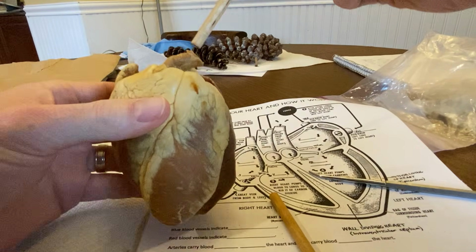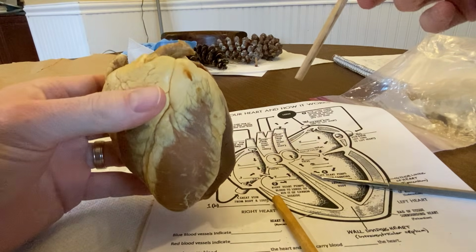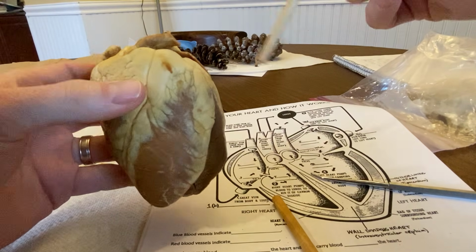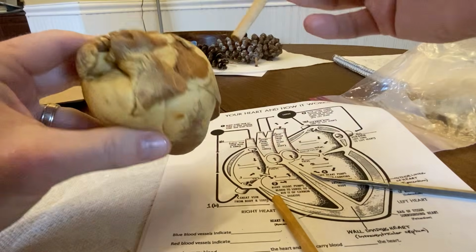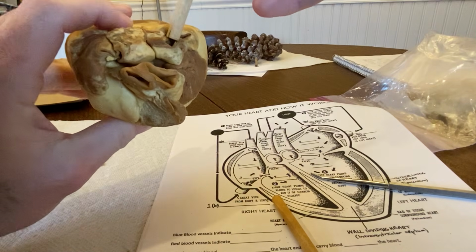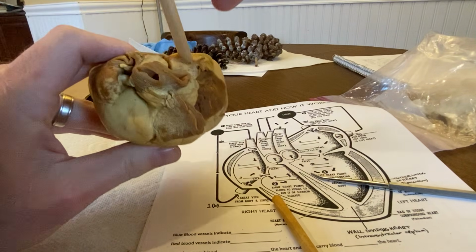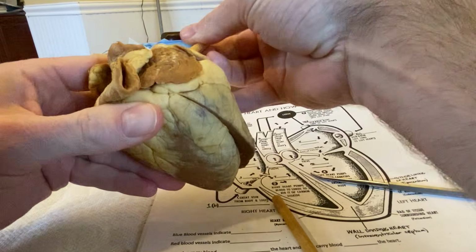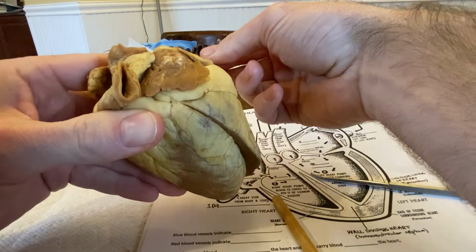And from the pulmonary artery, remember this blood then gets pumped to the lungs, and in the lungs it gets oxygenated and drops off carbon dioxide and comes back through the pulmonary veins. And the pulmonary veins are that big spot on the back of the heart that I just showed you, okay? And they would flow into the left atrium here. So now we're up here, you see it kind of poking into that left atrium at the top there.